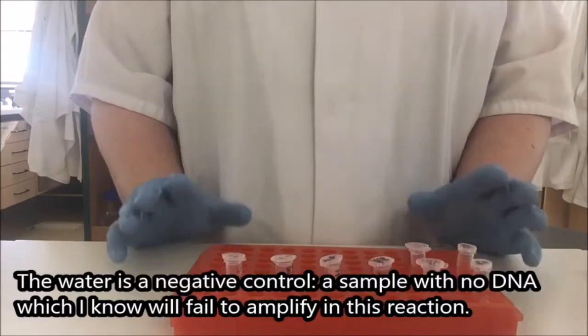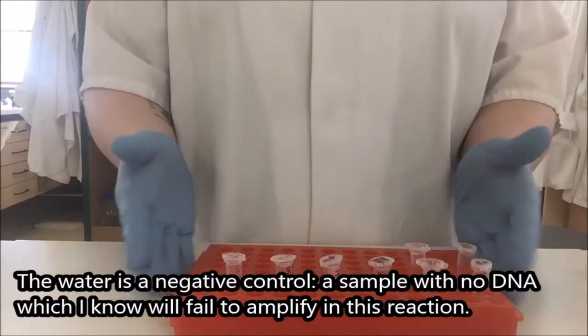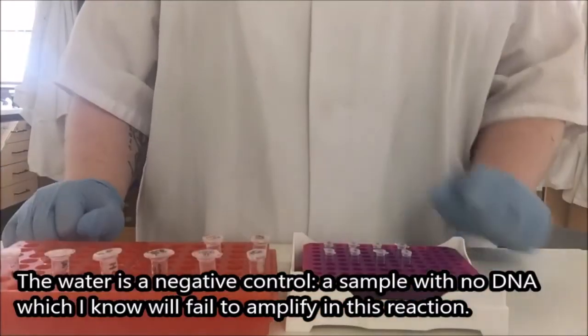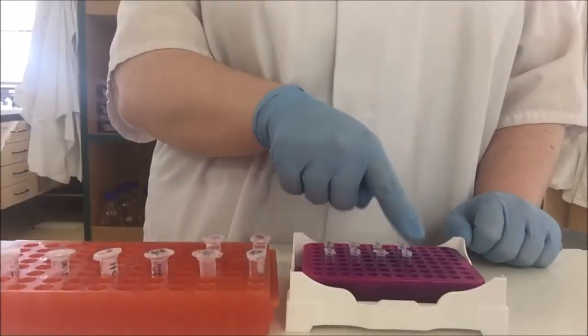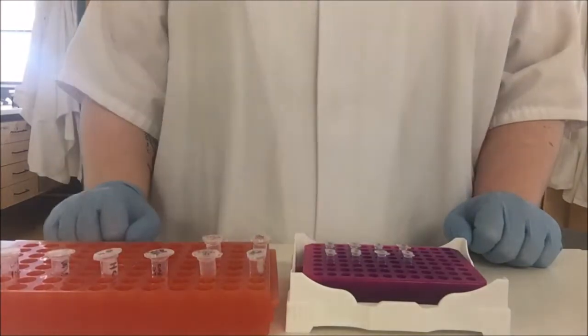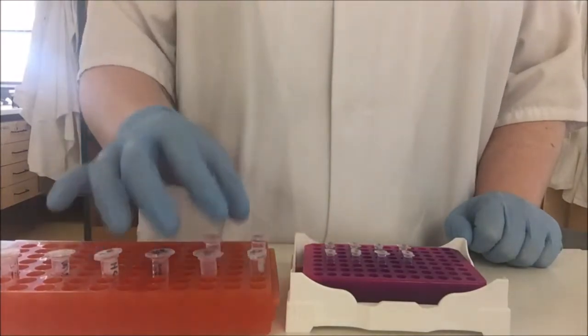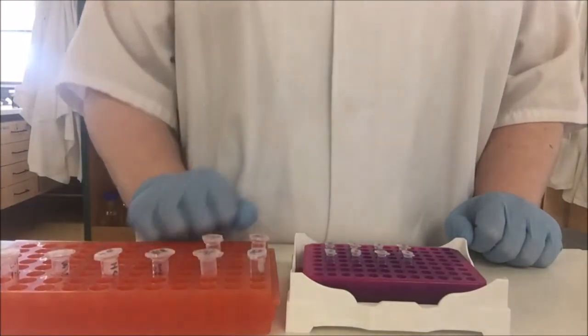So this is going to be our 8 samples that we are going to PCR amplify. I then have my 8 tubes. I've recorded which one of these samples is going into tubes 1, 2, 3, 4, 5, 6, 7, 8. So I don't have to record large amounts of information on these very small lids.